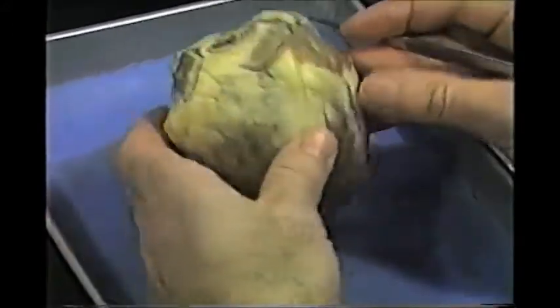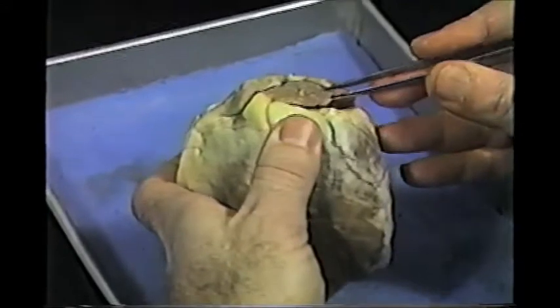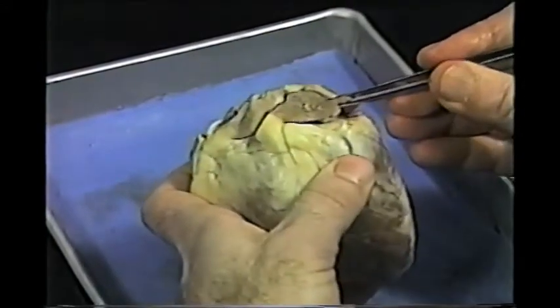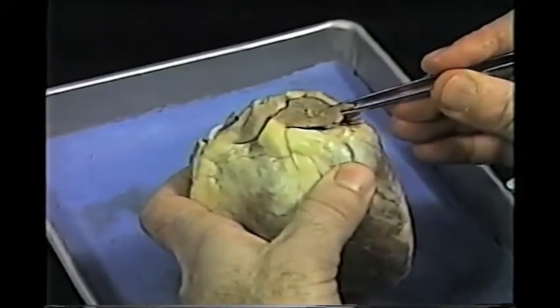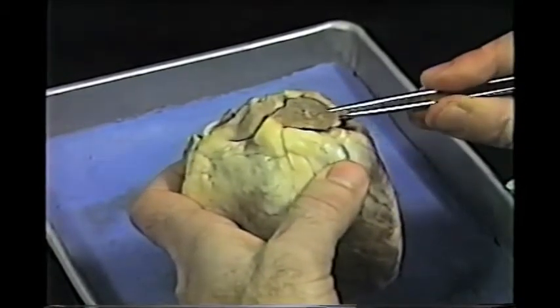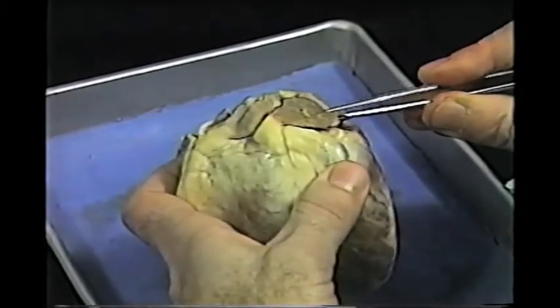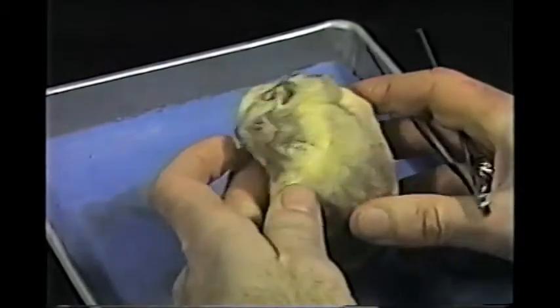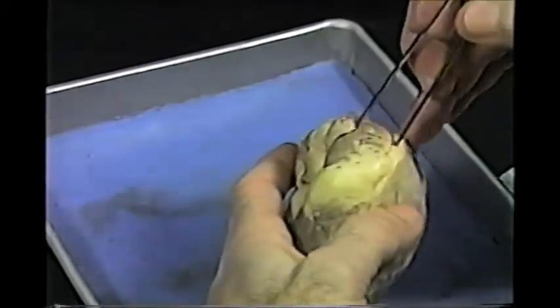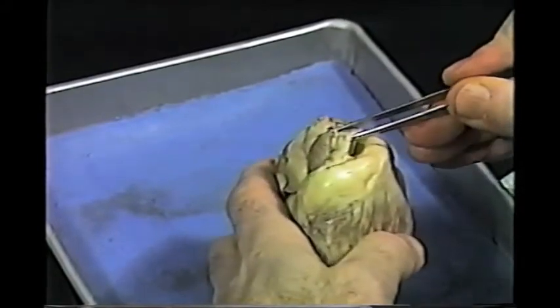At the top or the base of the heart, we have these two ear-like structures which are called auricles. This would be the auricle servicing the left ventricle — therefore, this is the left auricle. Here is the auricle servicing the right ventricle, so this is the right auricle.